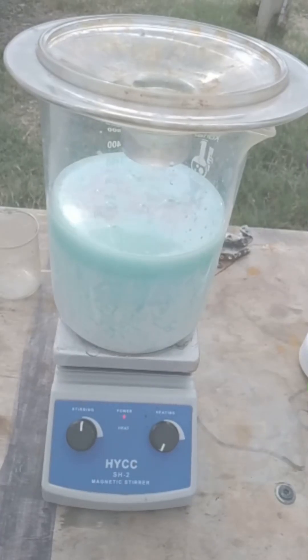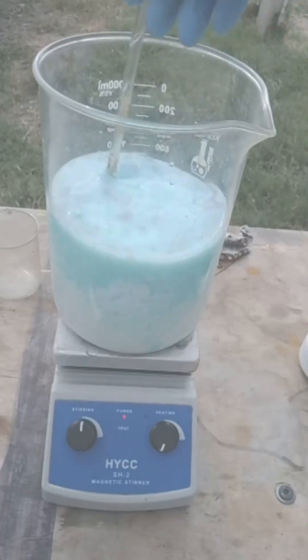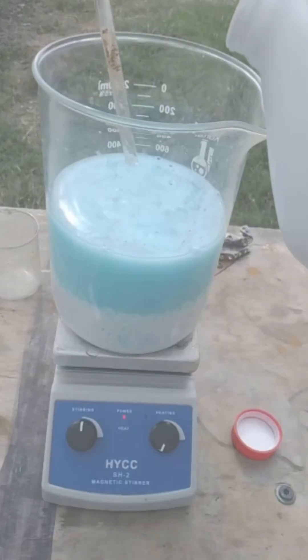What's going to happen is you're not going to see that happen anymore when you pour in your muriatic acid. It should stop happening, and when that stops happening, that's when you know it's done. Another indicator is when you start to see the muriatic acid saturating the nitric acid. Yeah, you'll start seeing it turn yellowish. That's another indicator that it is practically done and there's no other silver chloride precipitating out of the solution.